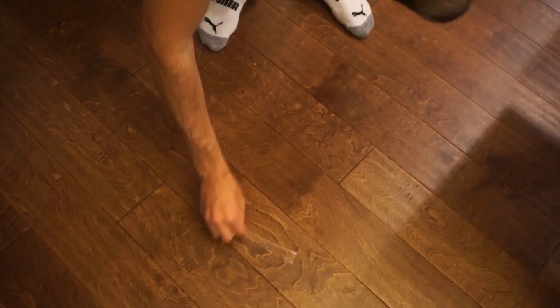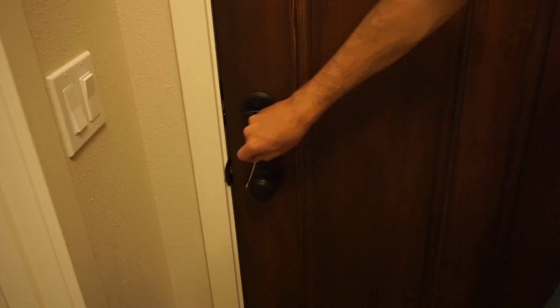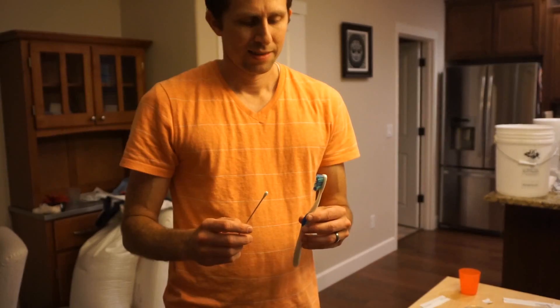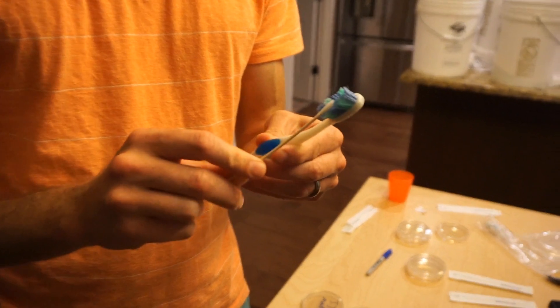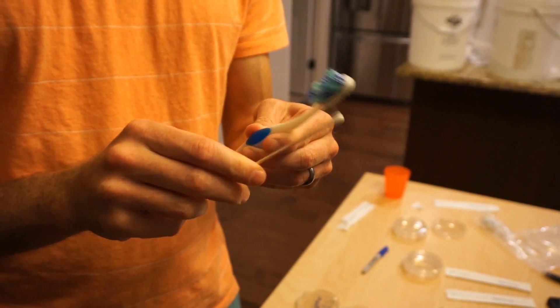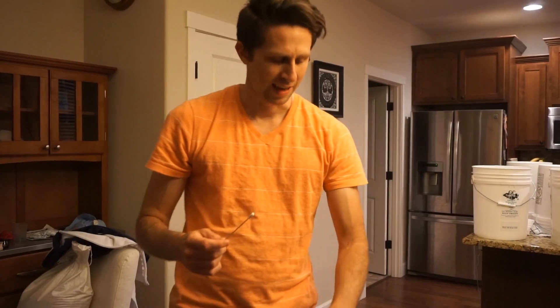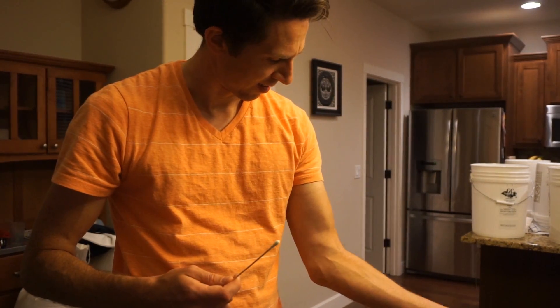This is my mouth. Here's the floor. Good swipe all around the front door. This is my toothbrush — the bristle end of it. Rub it all in there. Now I'm going to do my skin — there's a gross part of my skin: your armpit.